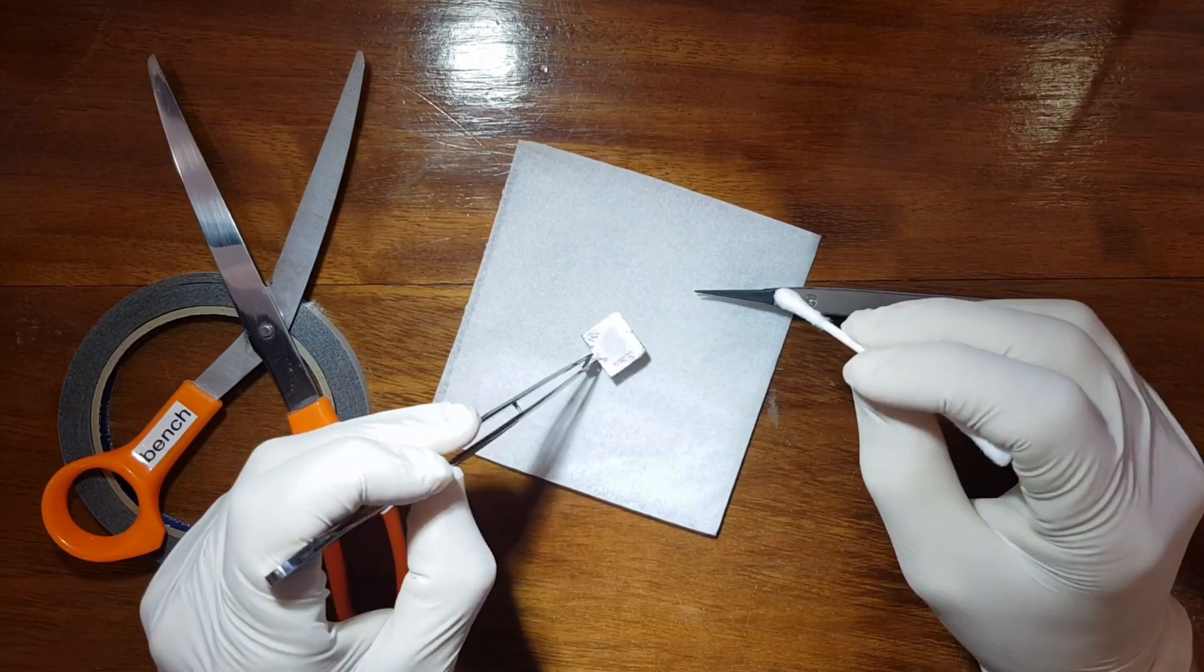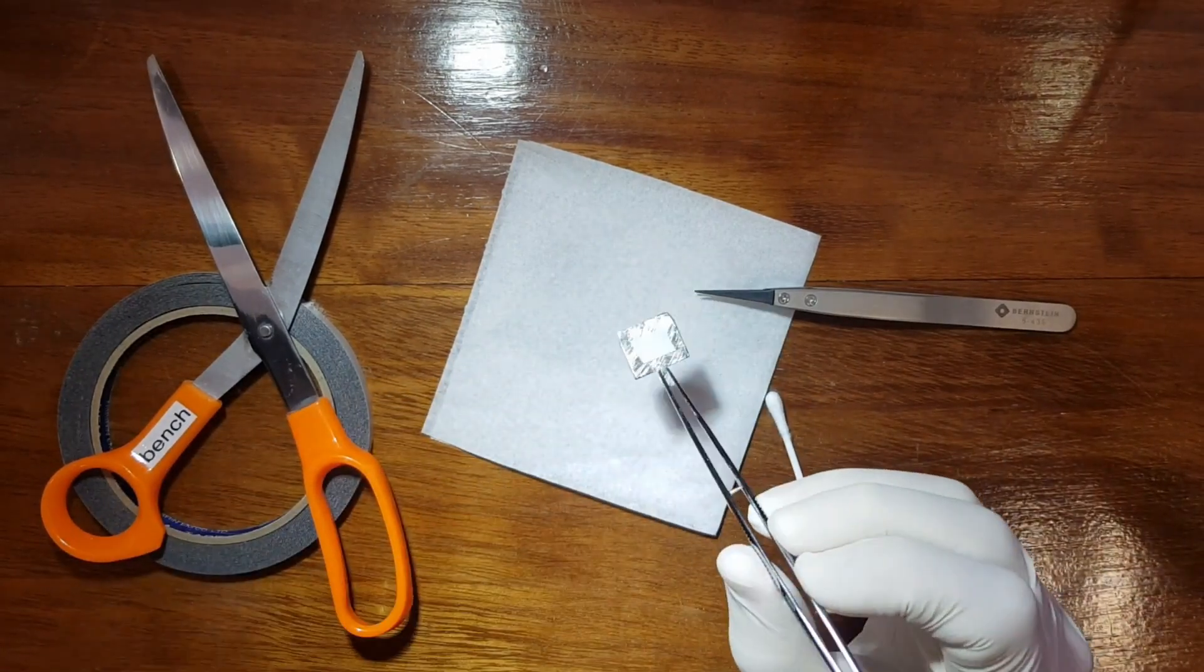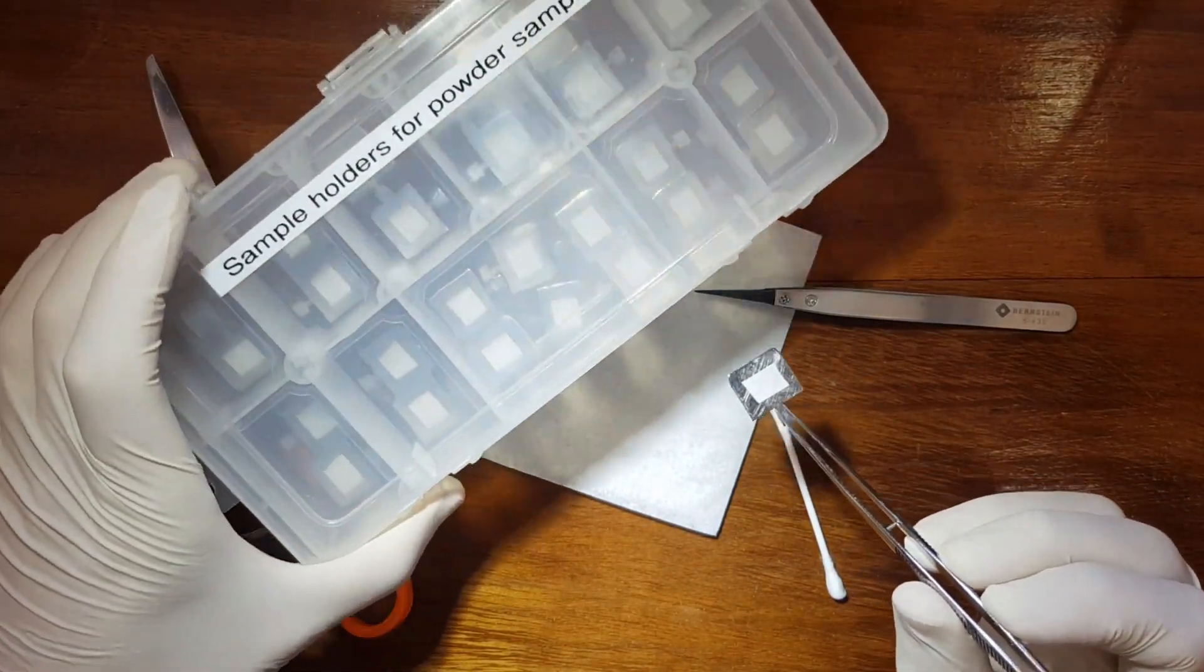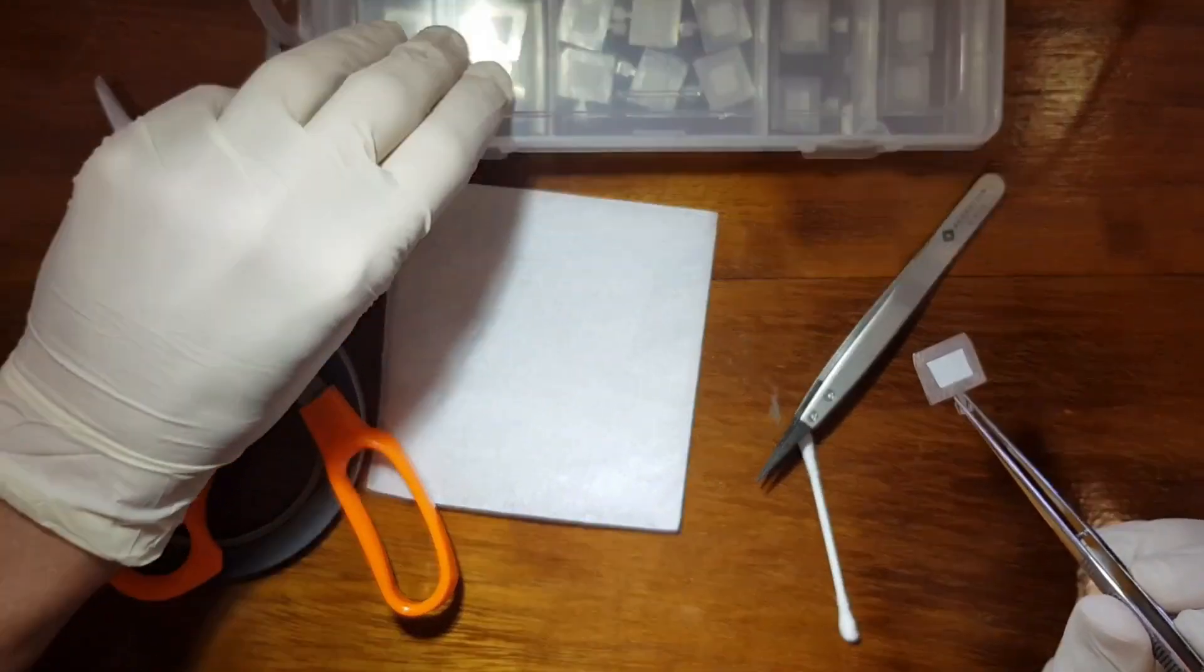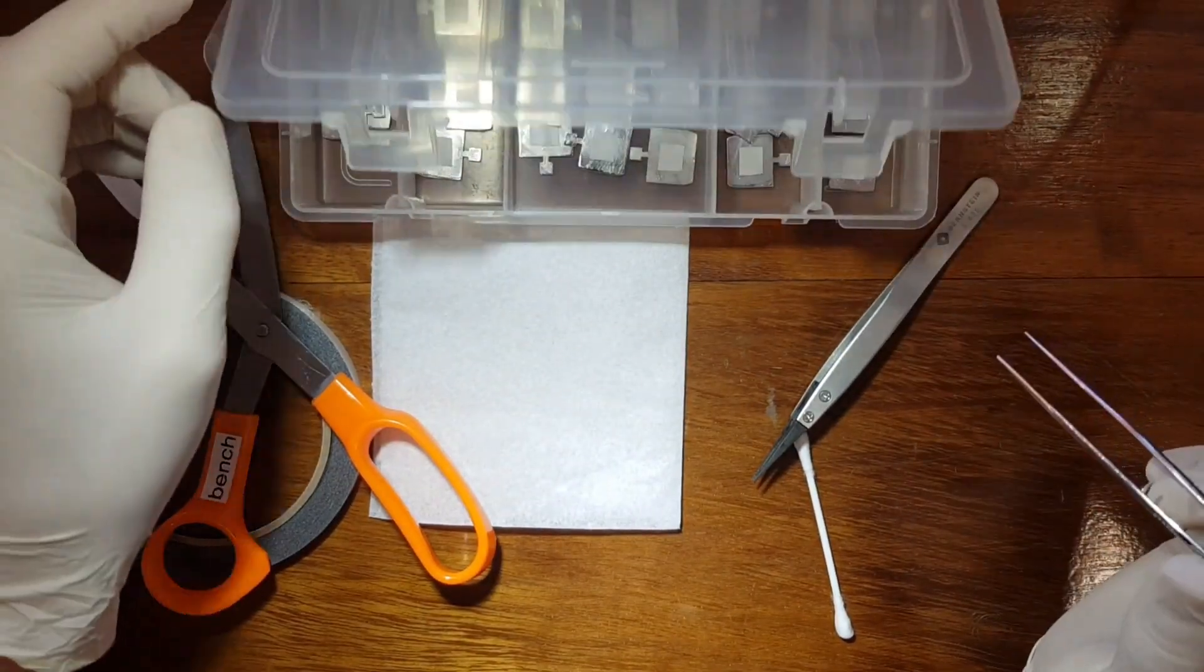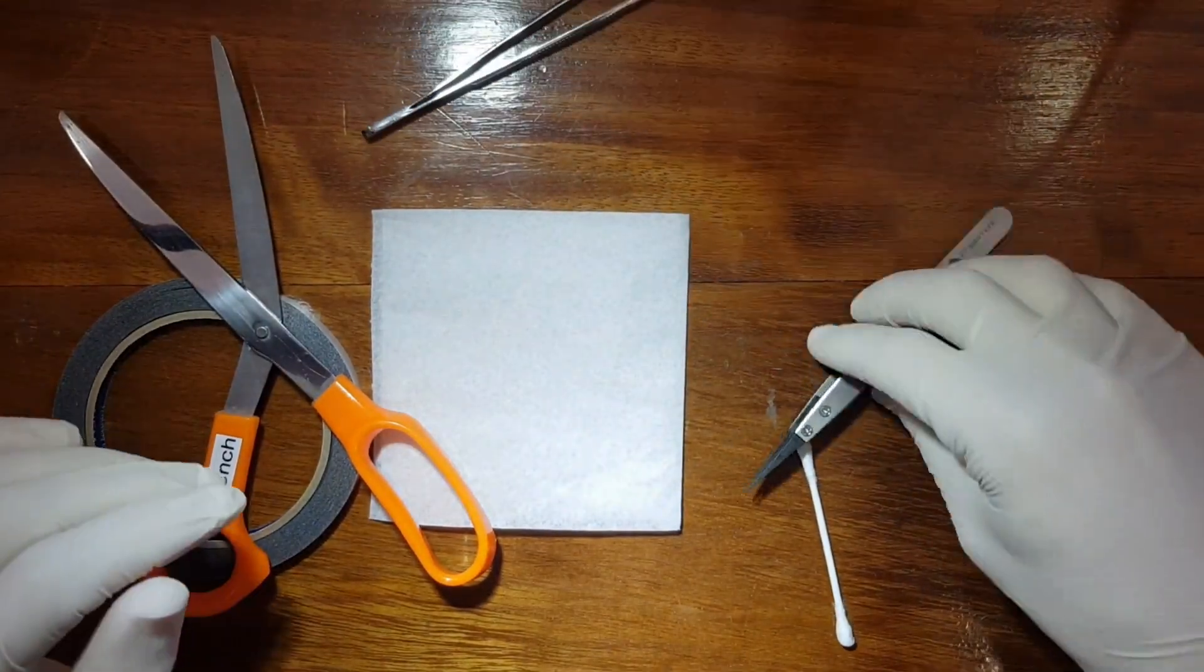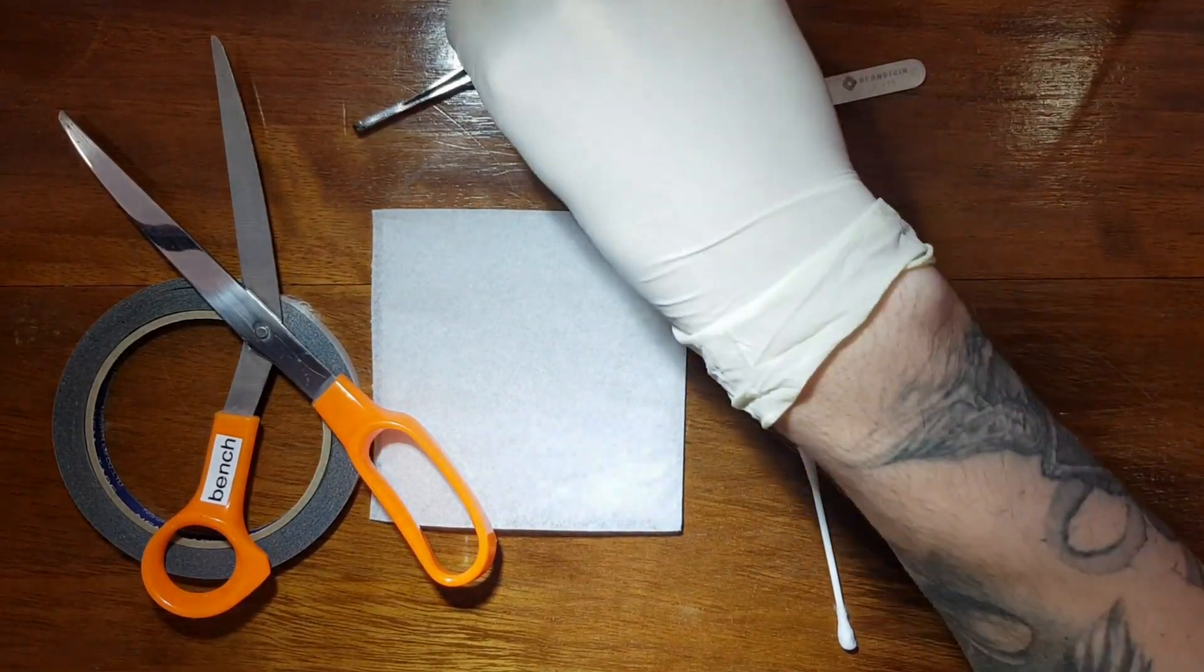And there we go, that is our sample prepped. This goes into a special container called sample holders for powder samples, and you can just store it in there. I'm going to do one more just for demonstration. Well, that's the end of the video. Grab a sample.